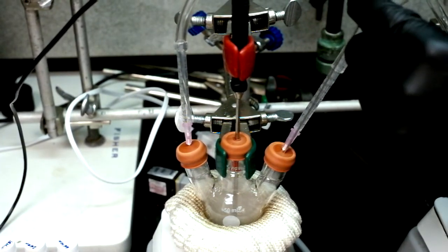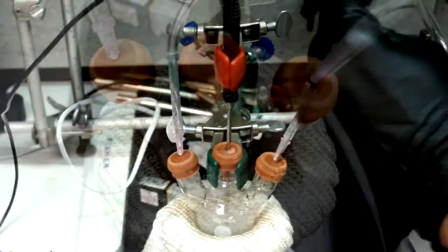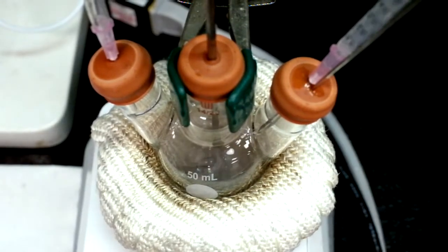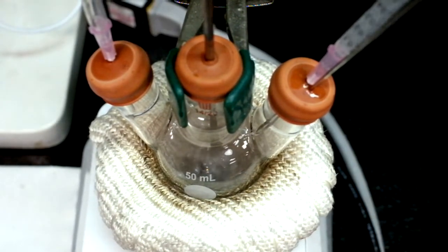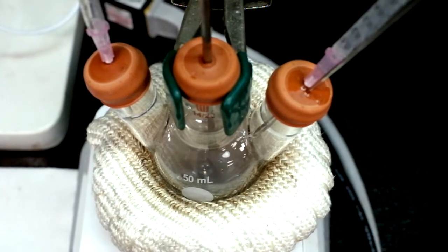To track the growth of the shell, immediately check the fluorescence of the taken samples. When the reaction begins, the solution will turn a yellowish-brown color and as more shell is added, it will become a darker brown.